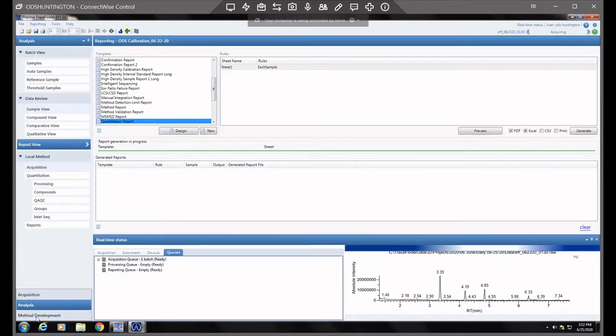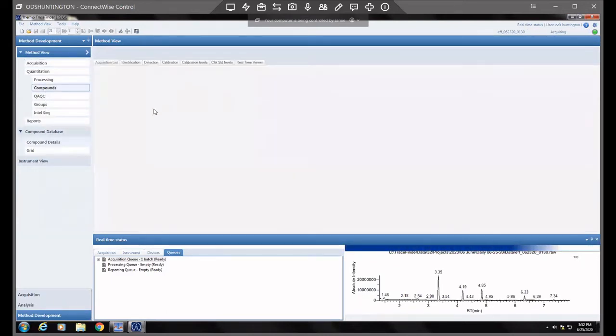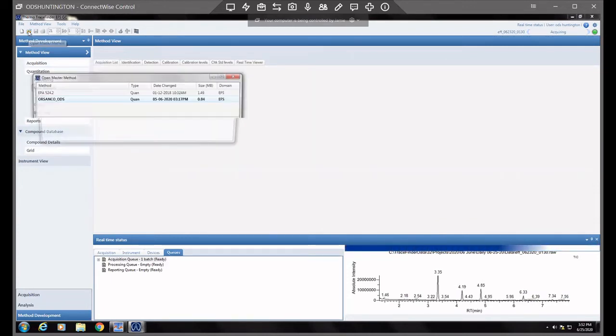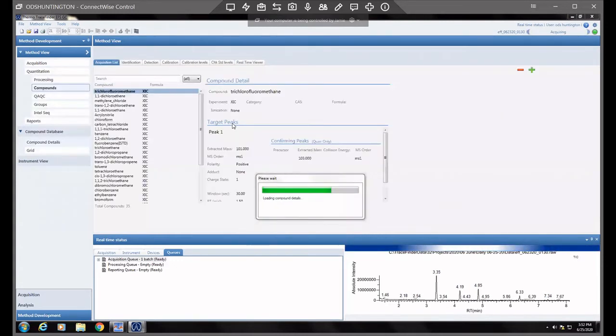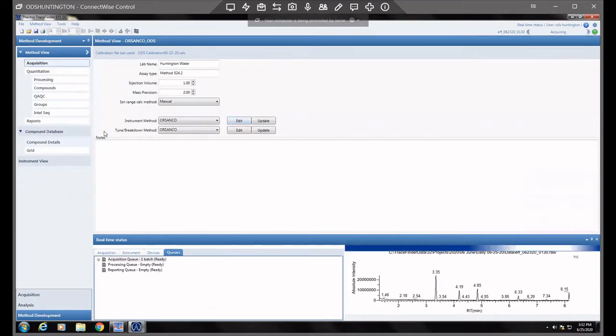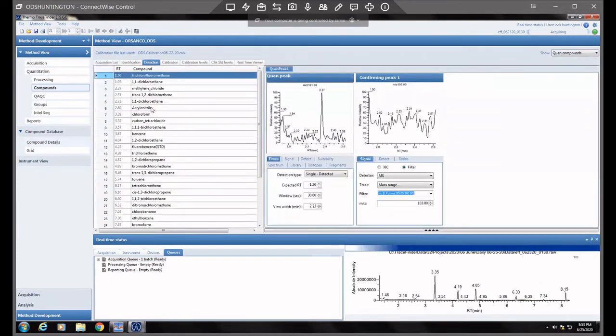So what we'll do is go to method development. If you click on compounds, nothing pops up, but that's because we haven't opened our actual method. So go to the open master method folder here, and click on the method that you're normally using, which is probably something labeled with ORSANCO. Open that. Again, click on this compounds tab, and then click on detection. And here are the 30 compounds that we're calibrated for.